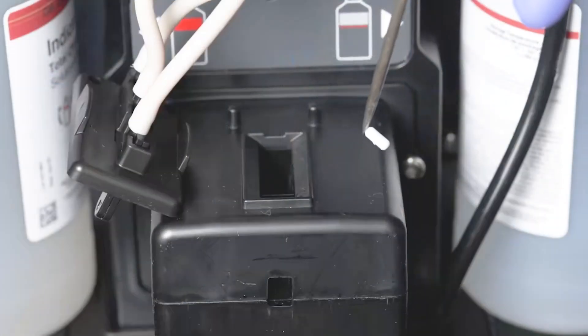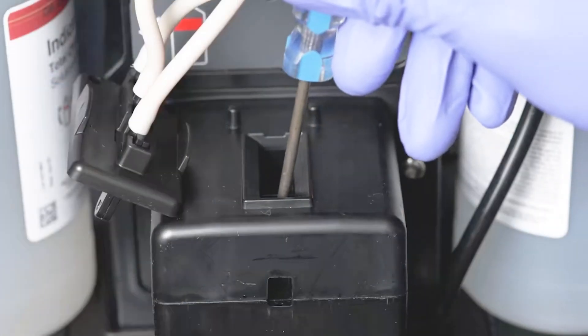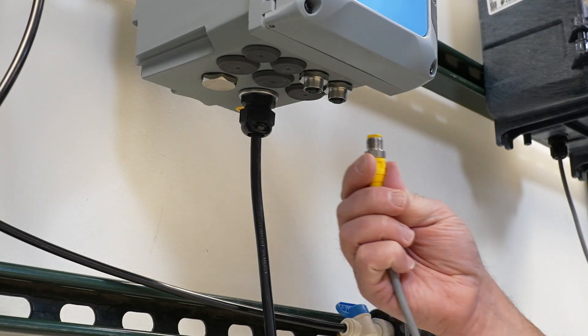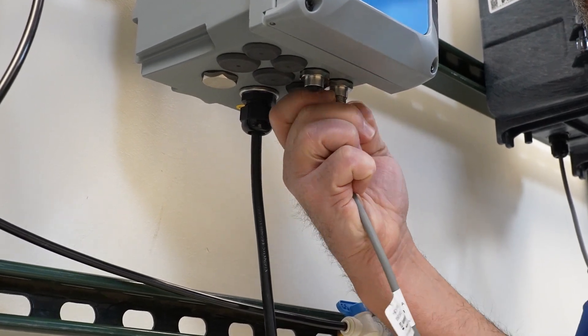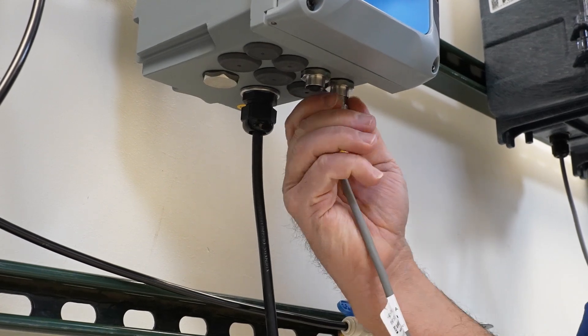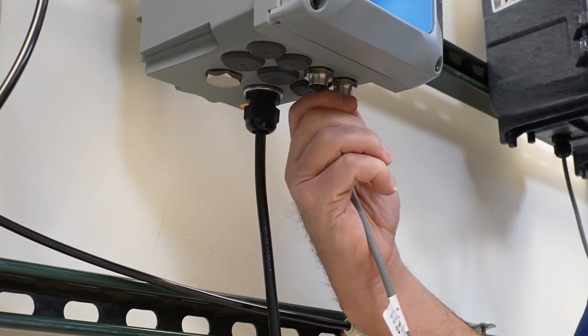Install the stir bar. Connect the analyzer to the controller. Connect the controller to power.